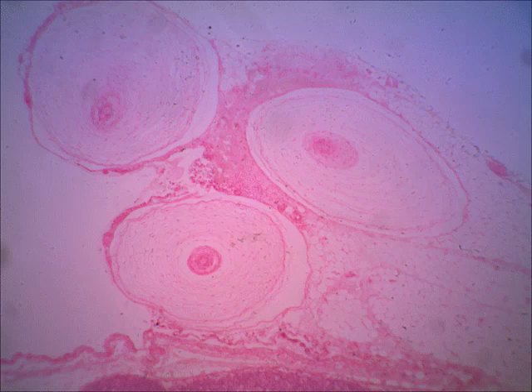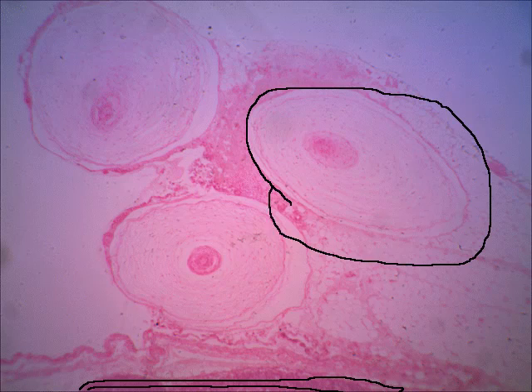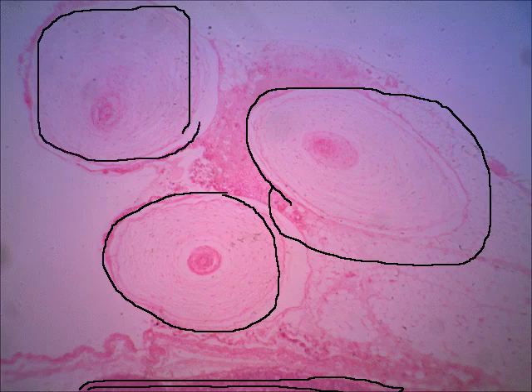I believe this one is just located outside the wall of the pancreas. Down here at the bottom of this slide, this is pancreatic tissue. I know you can't really tell anything about that right now, but we have three Pacinian corpuscles. There's one, and then here's the third. And you might remember from A&P 1, you can see some adipose tissue. You can see that there.